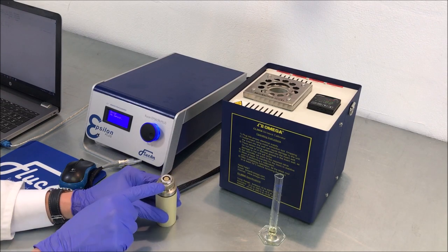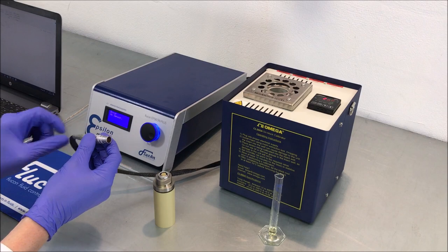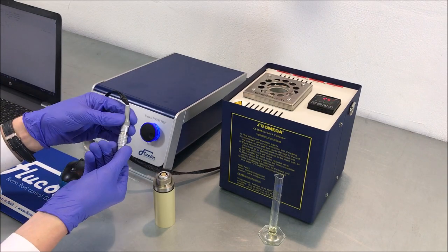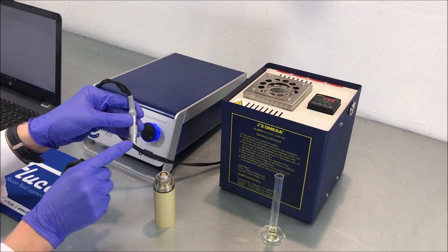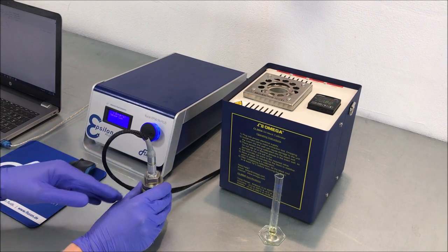Last, you want to reconnect the sensor cable. Find the red mark on both the plug and the socket and connect the sensor by a gentle push.